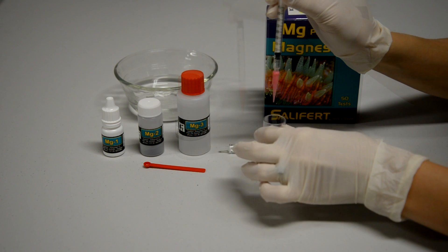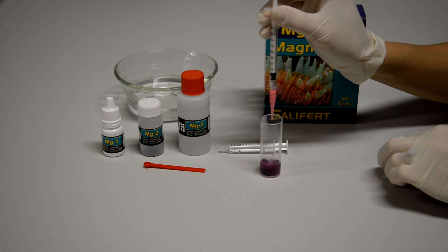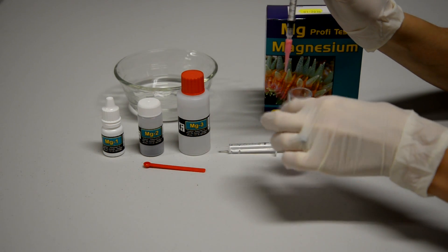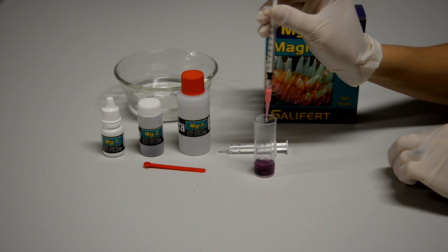It takes a little while. You're going to start seeing a purple though when you're getting close to the end. See it's turning a darker purple.